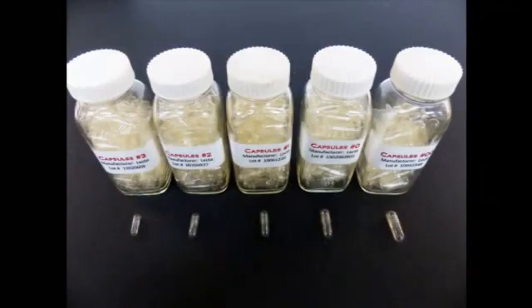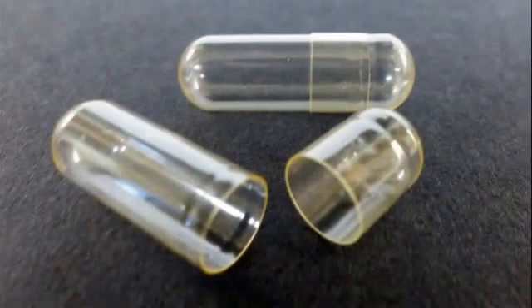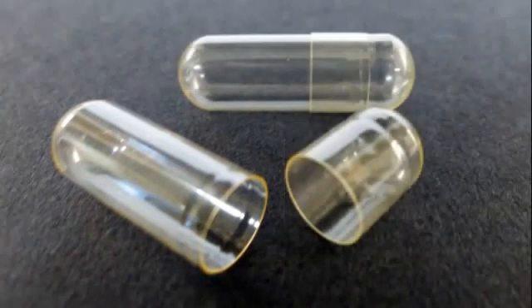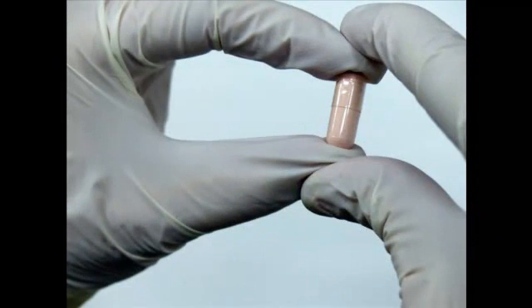When compounding, select the smallest size capsule that will hold the required amount of powder to maintain pharmaceutical elegance and ease of swallowing. There are two parts to a hard gelatin capsule: the head or cap, which is the shorter end, and the body, which is the longer end. The head slips onto the body to close the capsule once the capsule is properly packed. Some capsules lock and some do not.